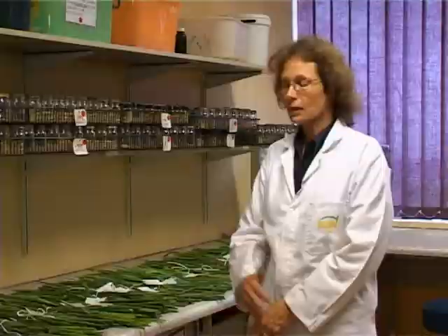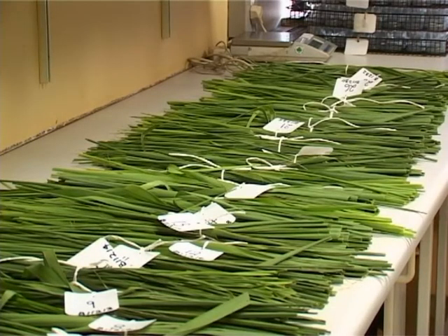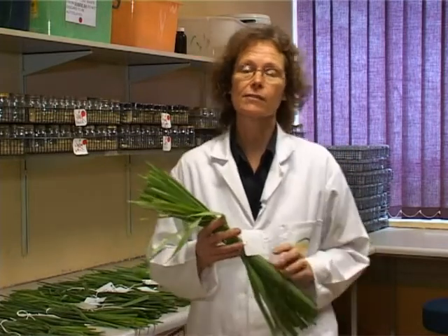Now that you've seen the processes involved with analysing your soil samples, let's look at the leaf samples. Leaf samples undergo a similar reception and registration process as soil samples. They are also dried overnight, but in this oven at 70 degrees Celsius.